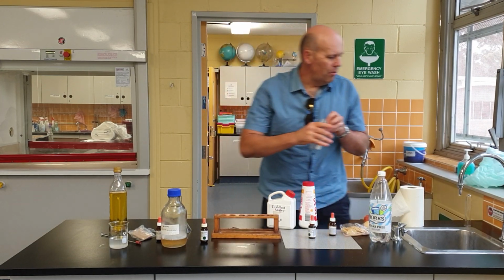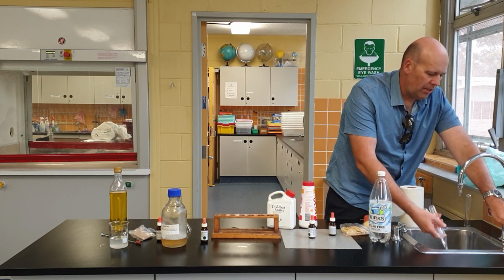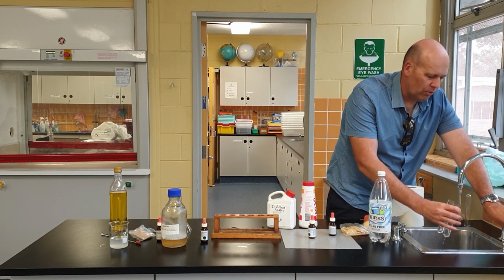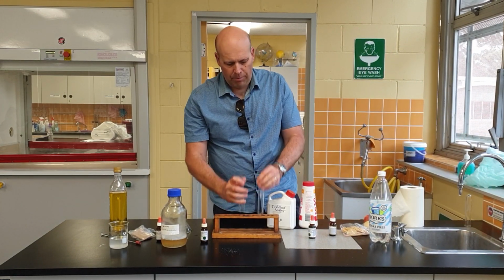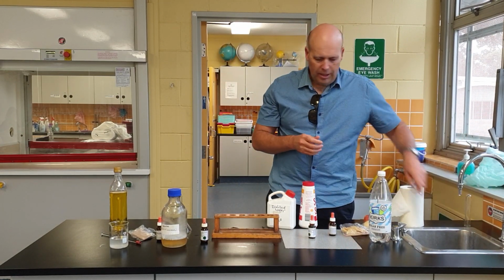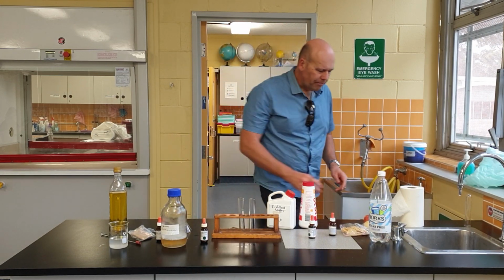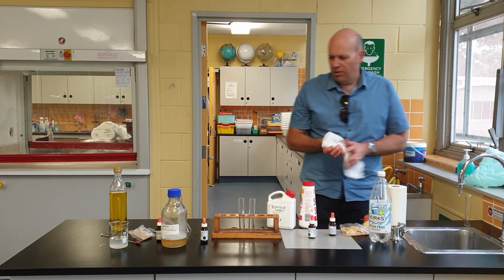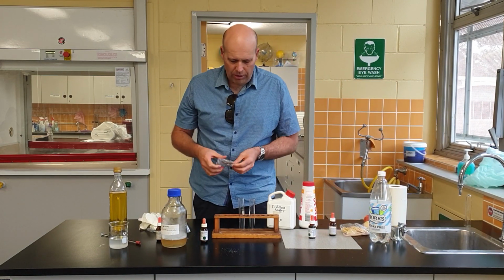Okay, so the next test we're going to do is the test for fats and oils, otherwise known as lipids. Lipid is a group name for fats and oils. Fats we find in animals, oils we find in plants. So what do we do here? Well, what we do is the test for fats and oils.